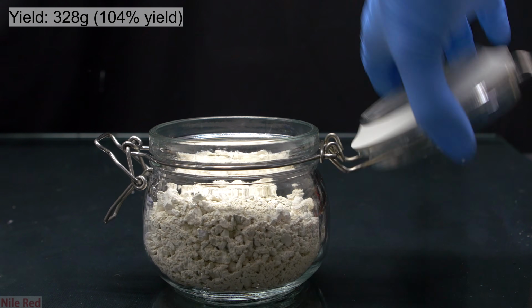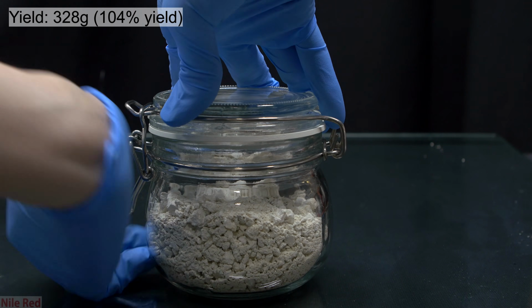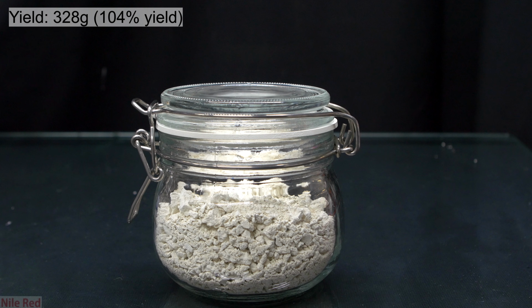The final yield of the mercury thiocyanate was about 328 grams, which is actually higher than theoretical, so it means that it's probably still pretty wet. This is okay though, and it's really not going to affect the demonstration.